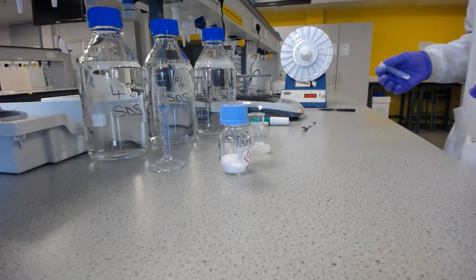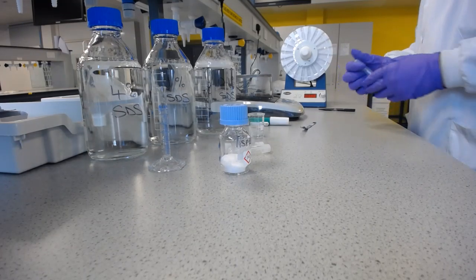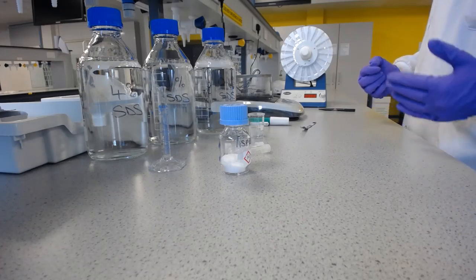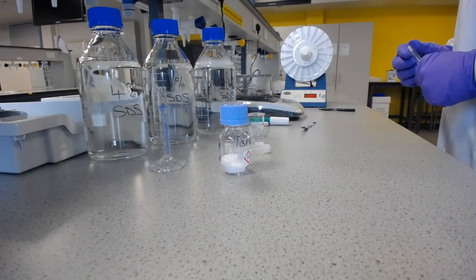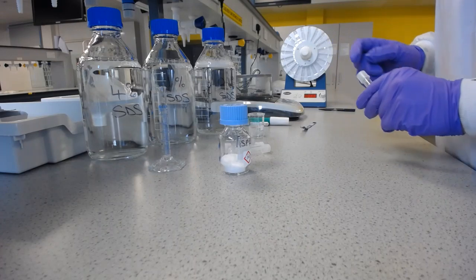As long as I've got over 200 milligrams and I'm around 200 milligrams for all of them, then it's not really important because we're just trying to saturate, aren't we? So we're just putting a known excess in to make sure we get to the maximum solubility, the maximum amount of aspirin dissolved in these solutions, so we're at saturation. And you'd be right in thinking that, but I'm just going through this methodically.